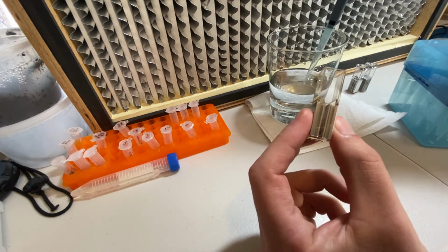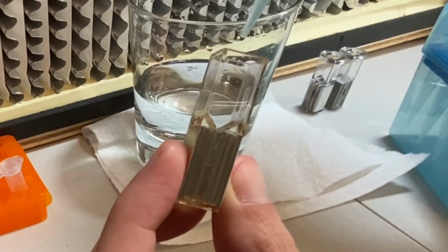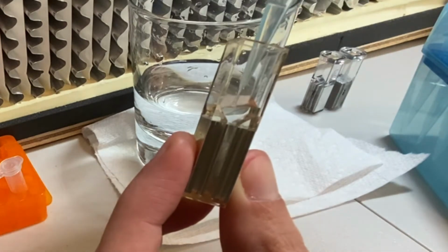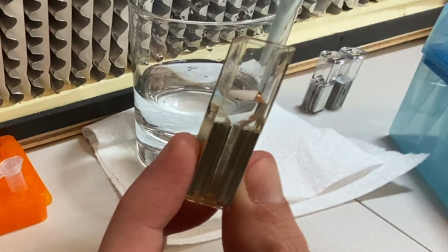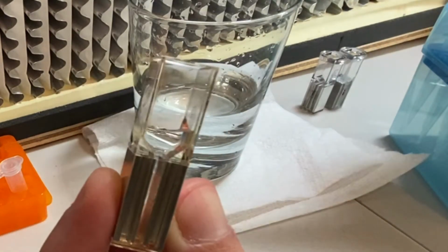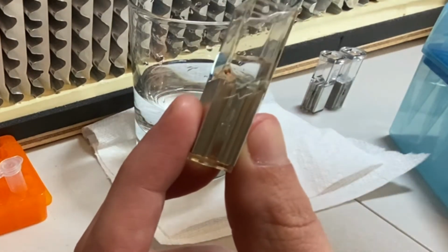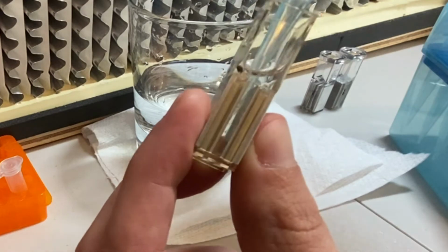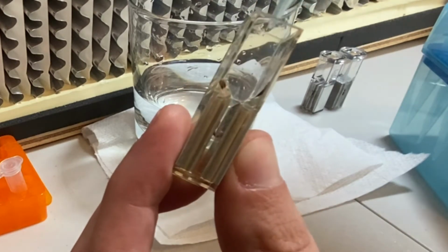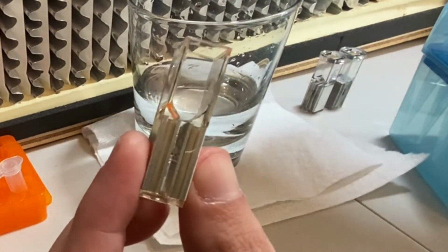Can we fit a full milliliter of LB broth in here? Well, let's see. Well, look at that. Turns out you can. You see that? Okay, now can we draw all of that out is the other question. So the top part is easy. So you can see how much I got out, not quite all of it, probably half of it.